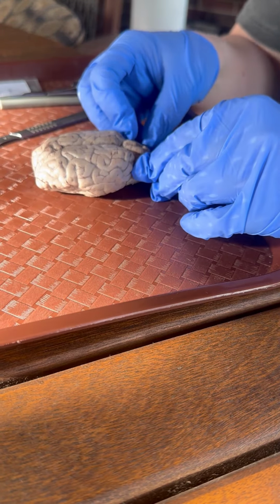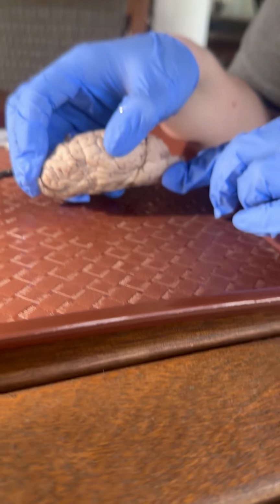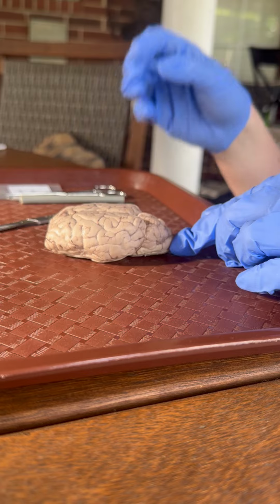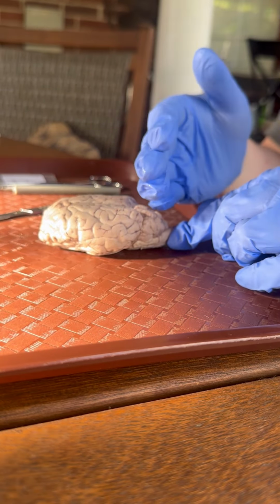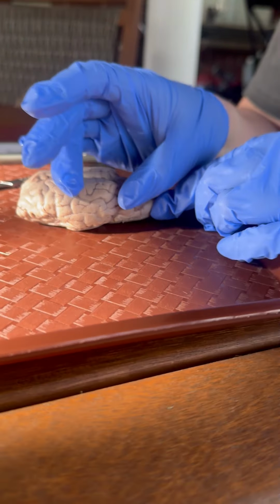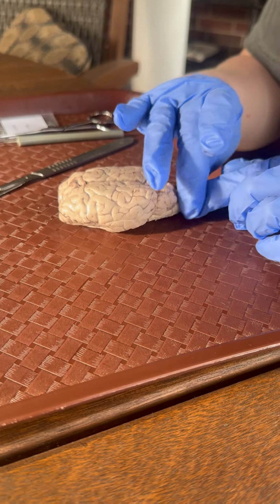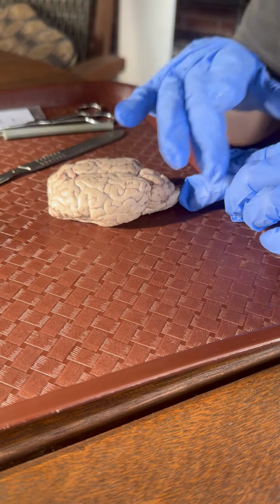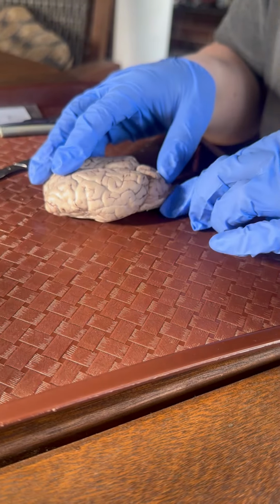Then once we go past the pons, we then move to the medulla right here. That's this area. And the medulla allows the nerve signals to cross over hemispheres. So for example, a lot of times if something was happening on the left side of the brain, that would then control the right side of the body. So the medulla is responsible for this transfer of information and signals. From one hemisphere to another, the medulla plays a huge part.